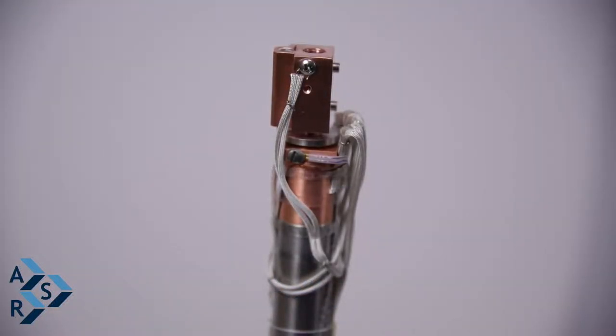We're here to talk to you today about installing a sample holder to an 800K interface and what precautions to take so you don't end up twisting the interface and damaging it.